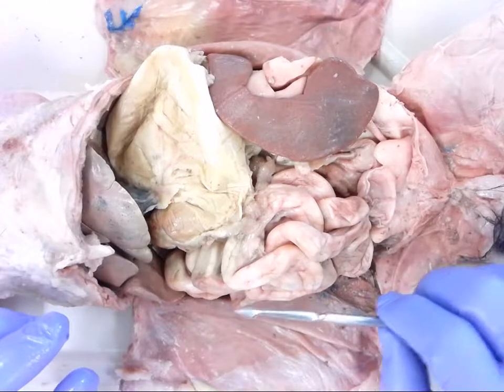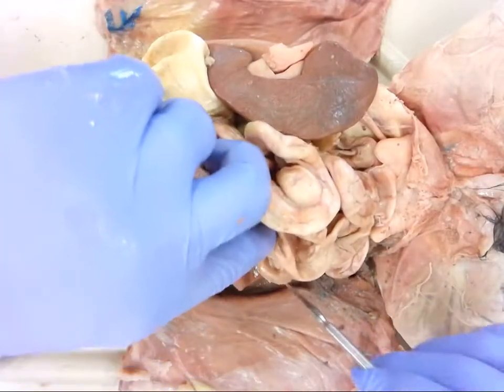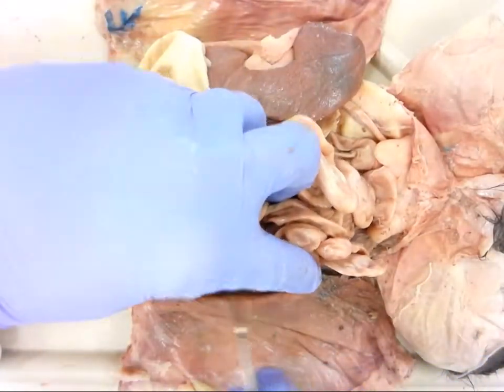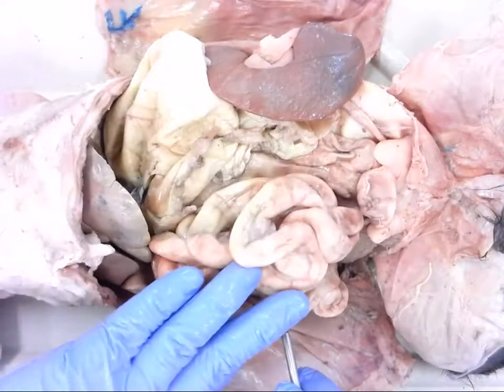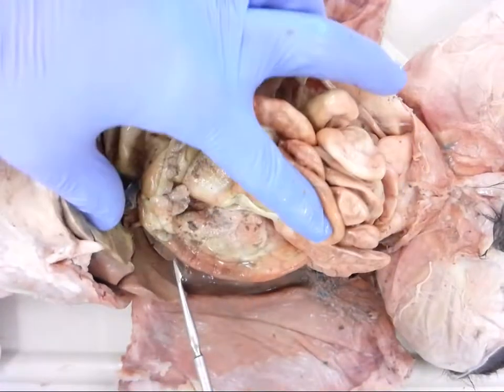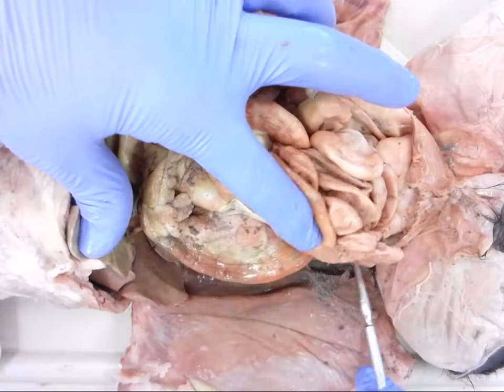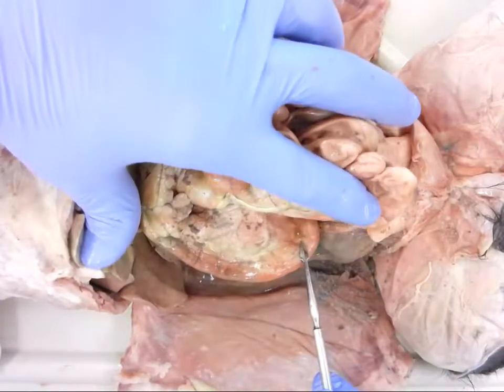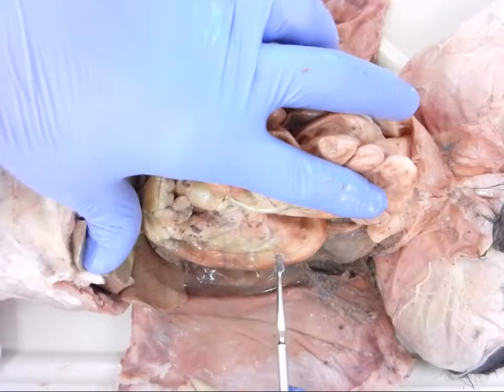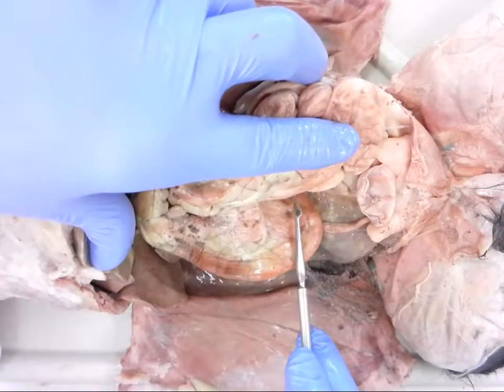Then we progress into the small intestine, which has three parts. The first part, just after the pyloric sphincter, is called the duodenum. This sits very deep in the abdominal cavity and you have to get all the other contents out of the way to see it. The stomach is here, then the pyloric sphincter, and it angles down toward the lower half of the body. The duodenum is a fairly short section — only a couple of inches.